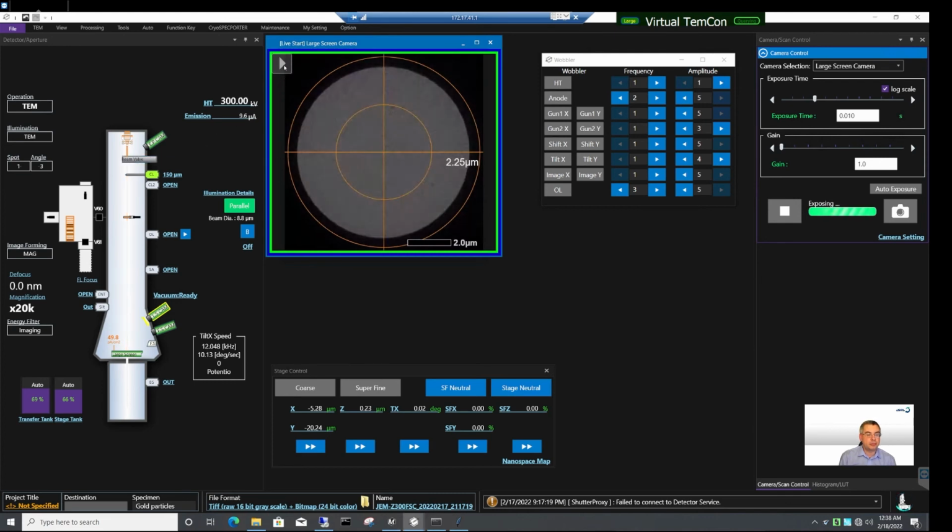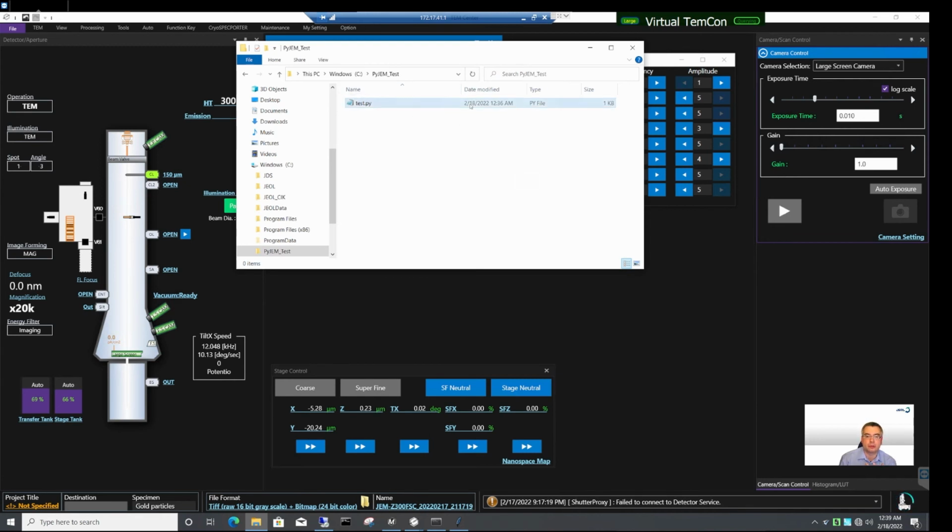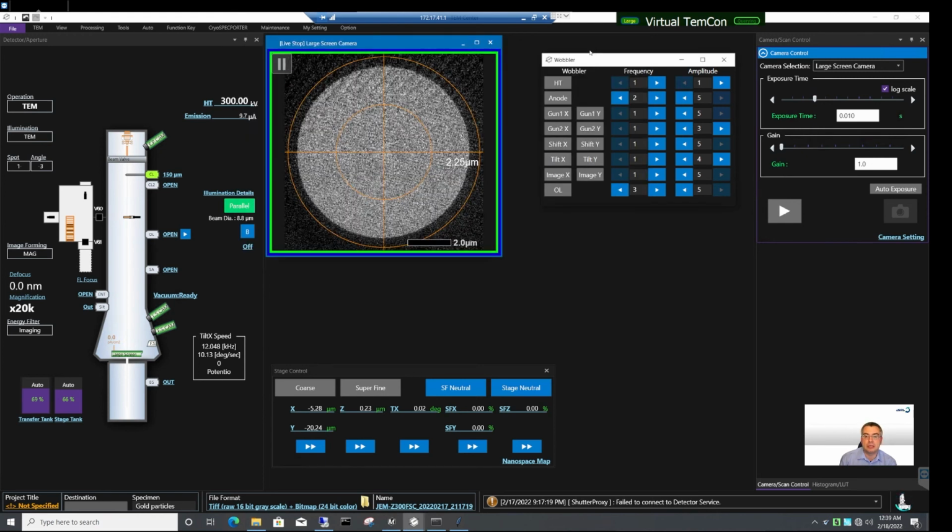So this is a very simple demonstration of how to use a very simple, natural, logical piece of code to create a graphical user application that you can use on a real microscope. This is how easy it is to use PyJEM to prepare graphical applications, especially simple graphical applications that make life easier. Although modern JEOL systems provide a parallel beam button, like here in TEM Center, older systems, for example 1400 or 2200, lack this button, and this is how you can create it and add additional functionality to older microscopes, to the previous generation of microscopes, using Python and PyJEM together.